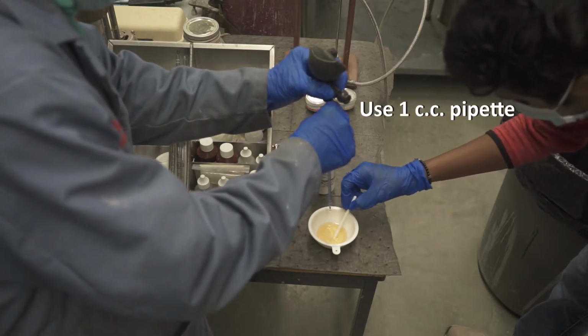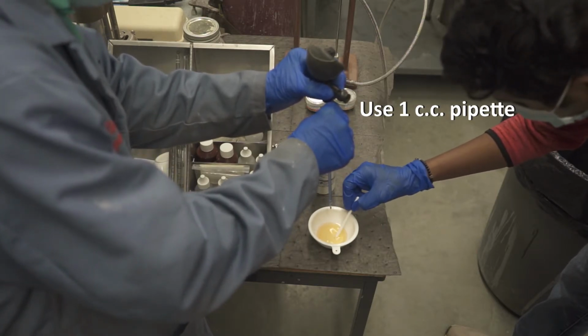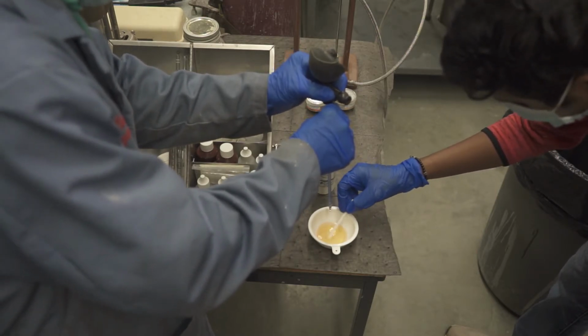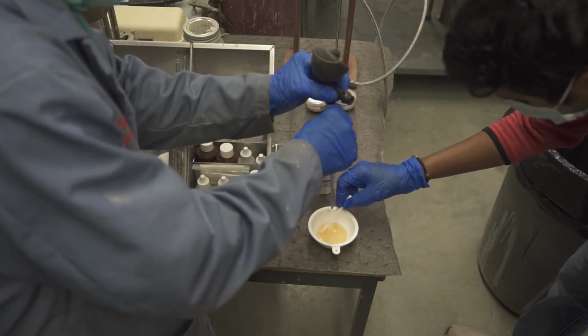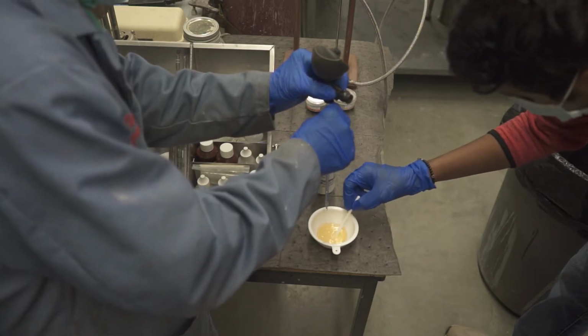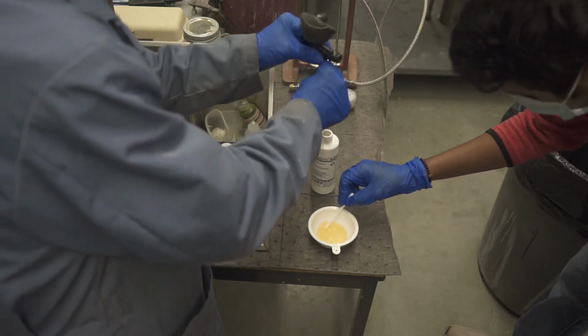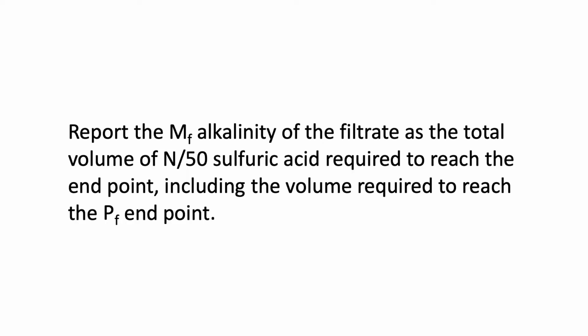This time, use a 1 cc pipette for both mud samples. Again, report the MF alkalinity of the filtrate as the total volume of N/50 sulfuric acid required to reach the end point. This volume also includes the volume required to reach the PF endpoint. Record all these past values found on the table.